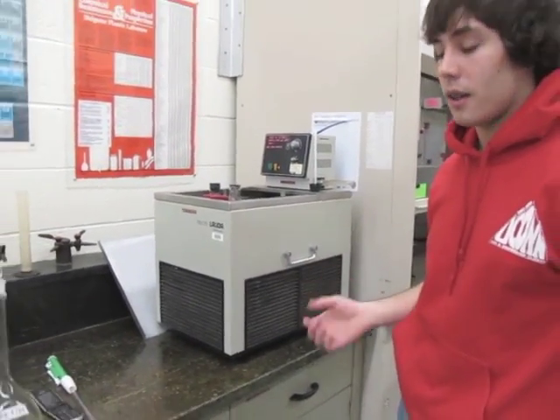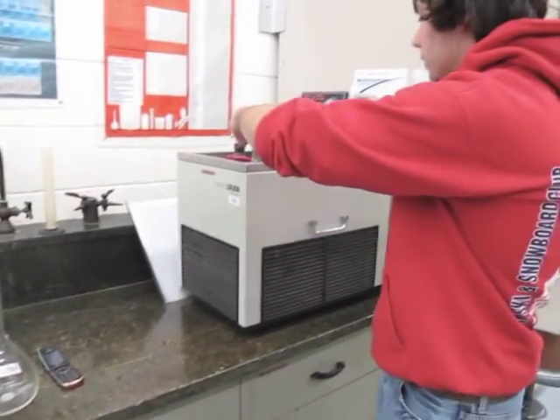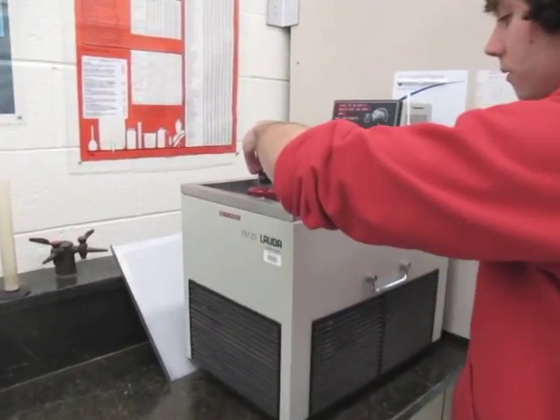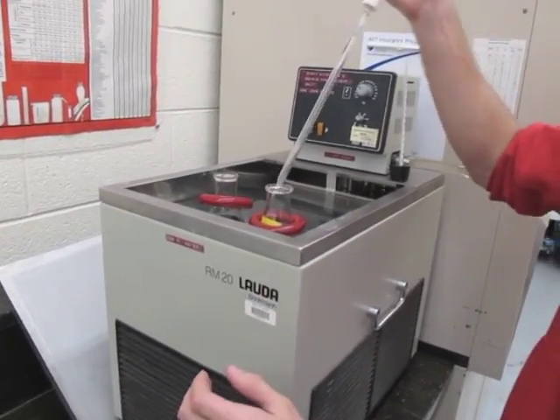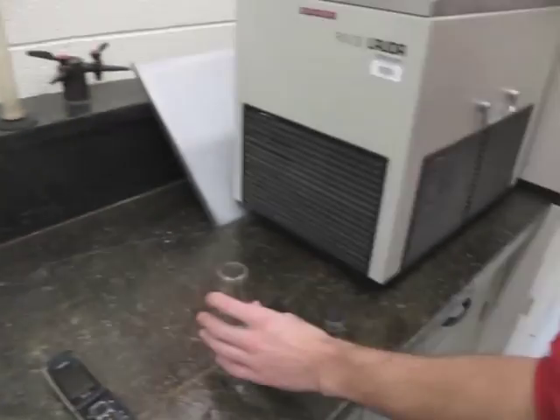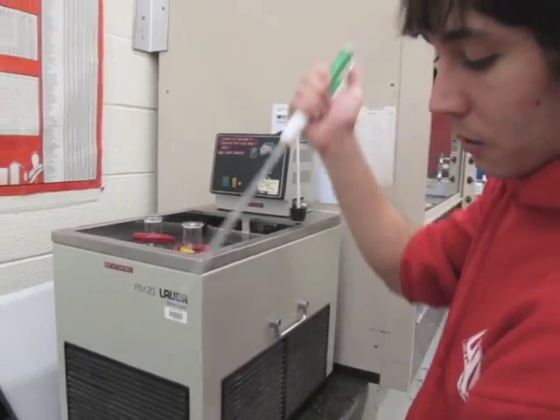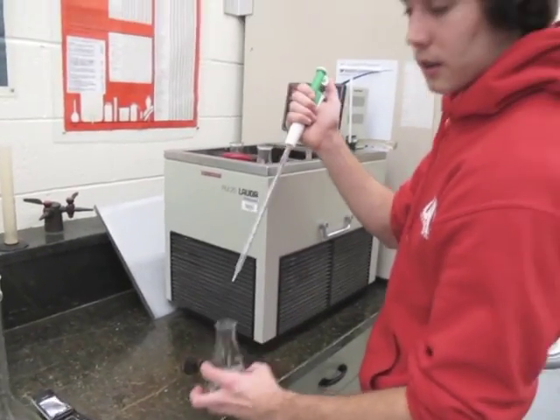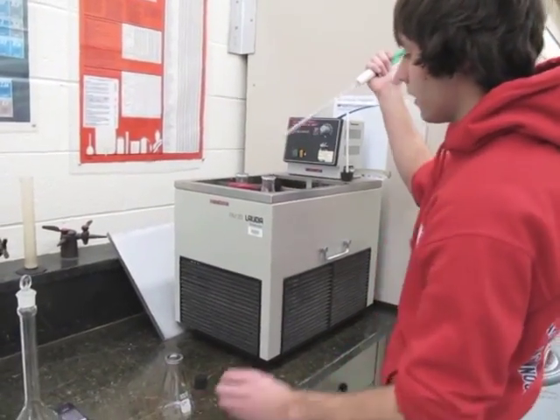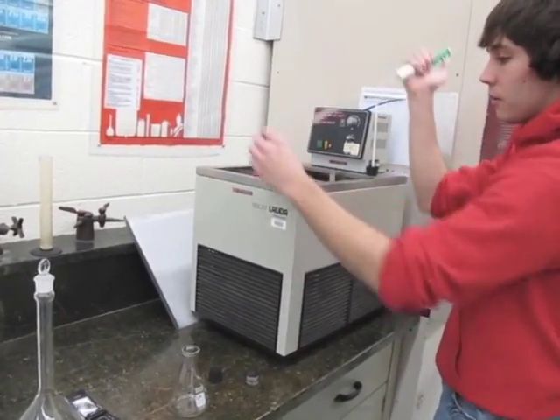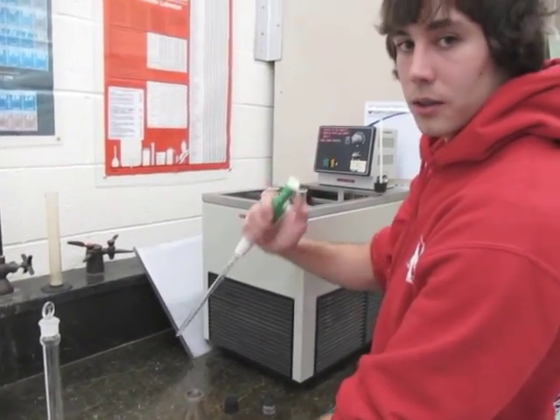When 15 minutes have gone by, you're going to take your pipette and draw five milliliters of sodium hydroxide. You're going to drop five milliliters of sodium hydroxide first, add it to the hydrochloric acid, mix it around so that they're well mixed. Then you're going to draw five milliliters of isopropyl acetate and add it to the flask of hydrochloric acid and sodium hydroxide.